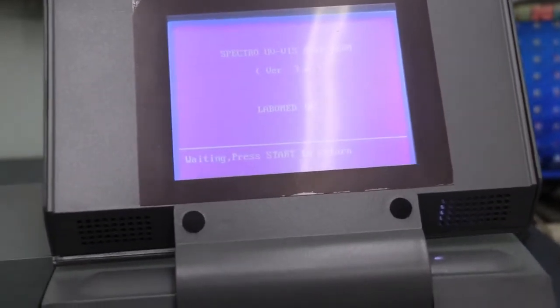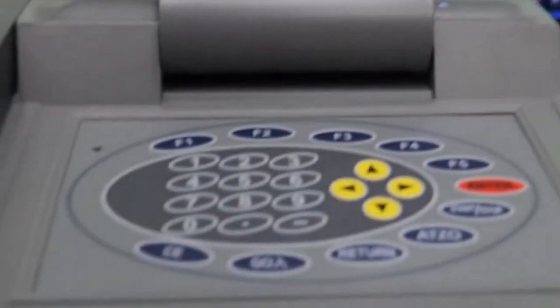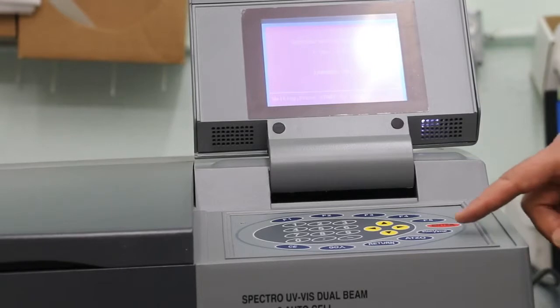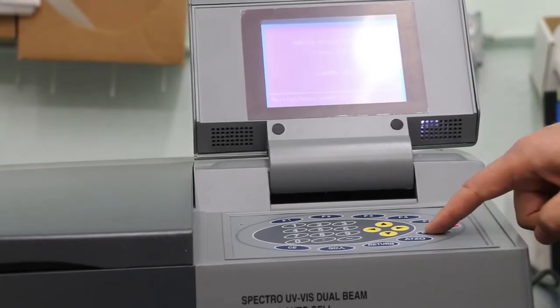Wait, let me get a close-up. How it looks. 1, 2, 3, 4. Okay. The unit is now in computer mode, so to run the self-test, simply press start.